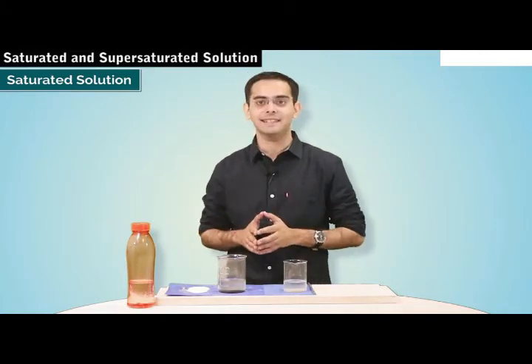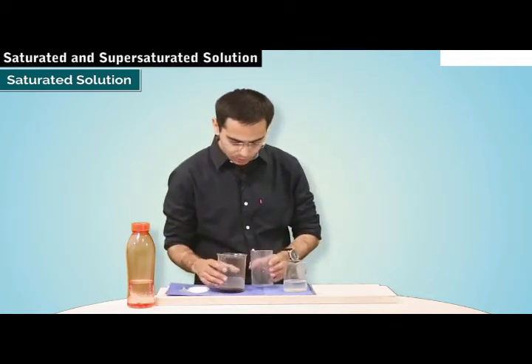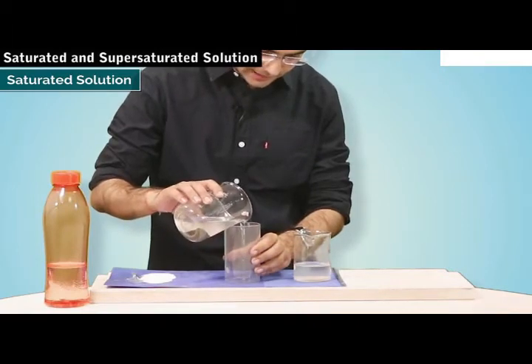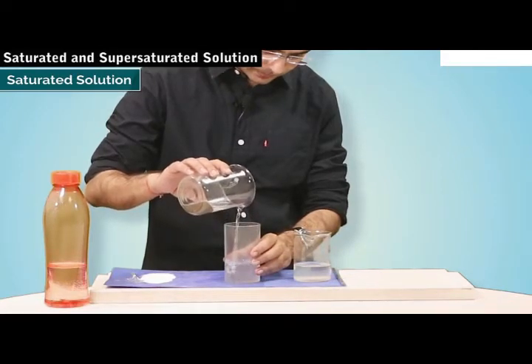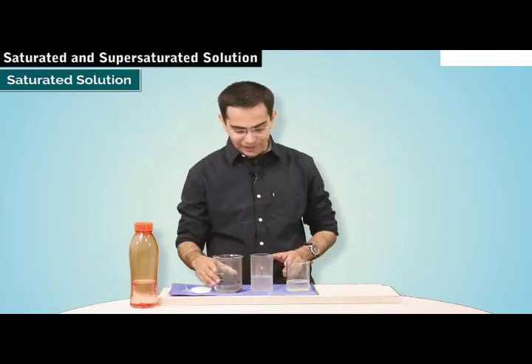Now we can decant the solution. So now we are going to pour this water into this glass.